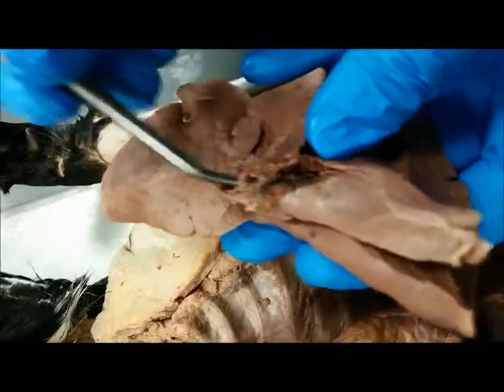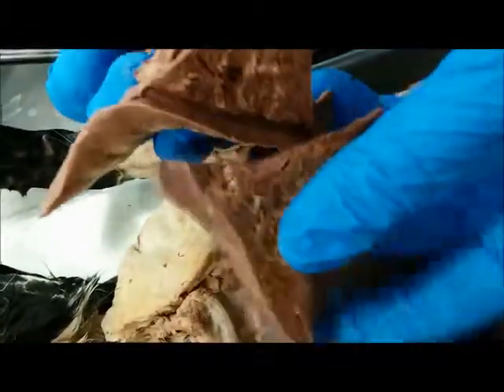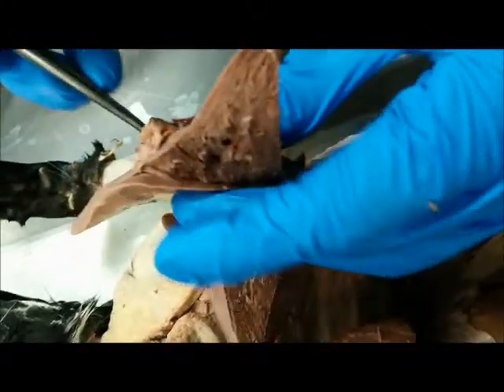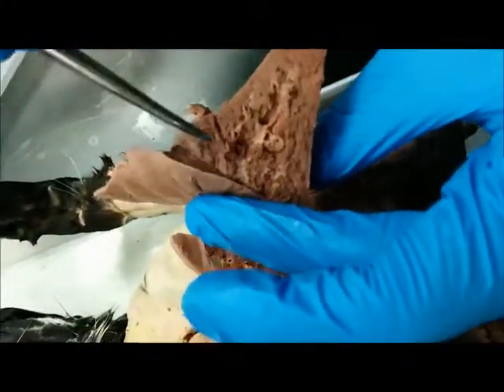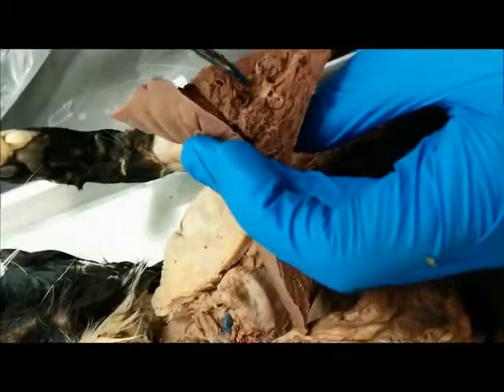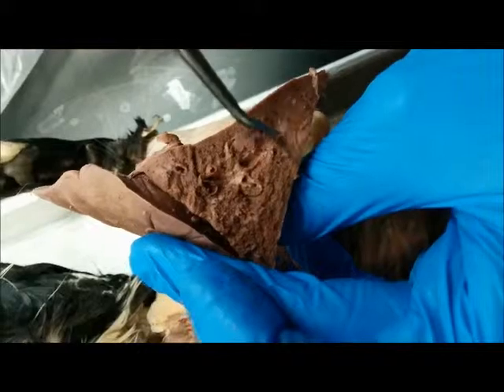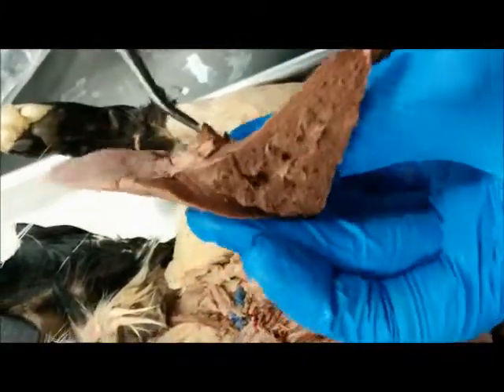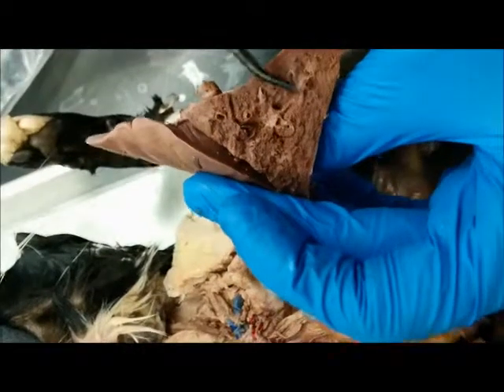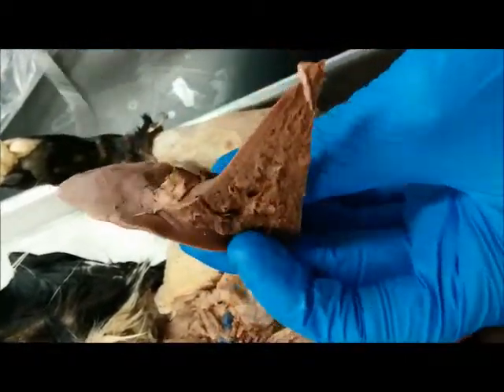And when you open the lung up here, cut it in half as we did, from the primary you're going to have a secondary bronchus, and then it's going to branch off. It's hard to see, but it's going to branch off into the tertiary bronchus. So from primary to secondary, and it branches off to the tertiary here, and that is that.